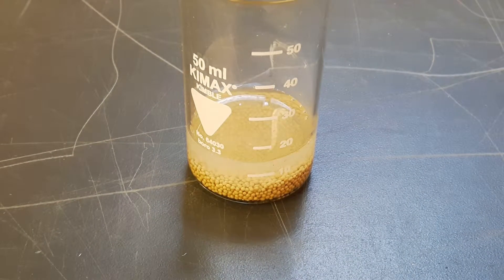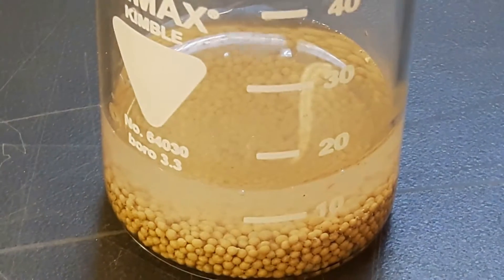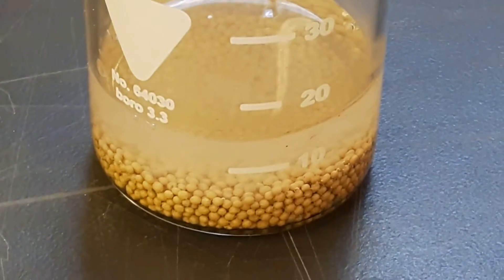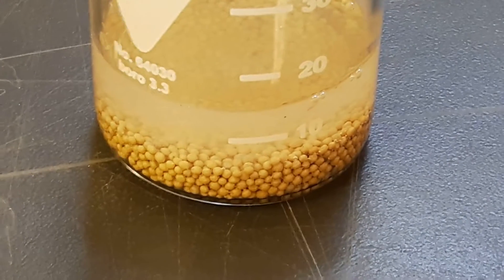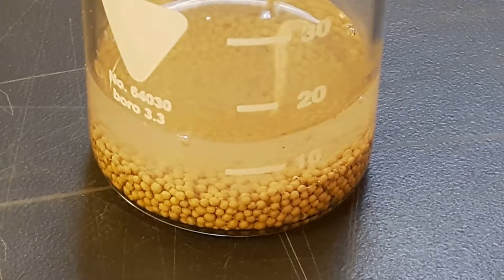The only thing that can happen is that the acid attacks the molecular sieves and gets neutralized, because I don't know if they are resistant to acid. And that's what I am going to find out now.